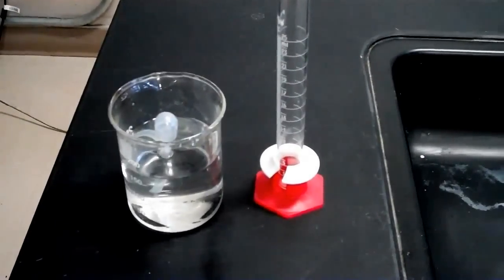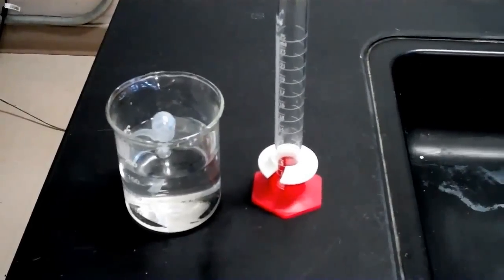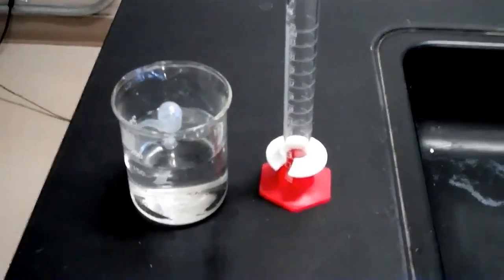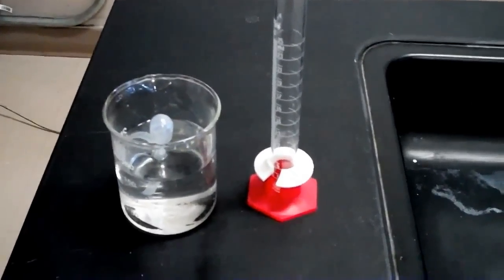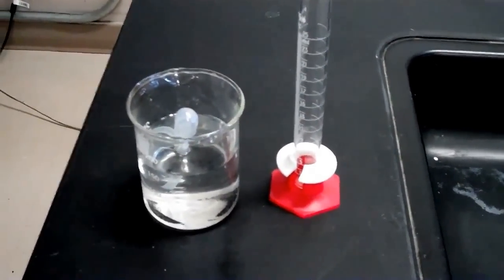Okay, I'm going to be showing you how to measure one milliliter of water. You need to find out how many drops are in one milliliter of water.